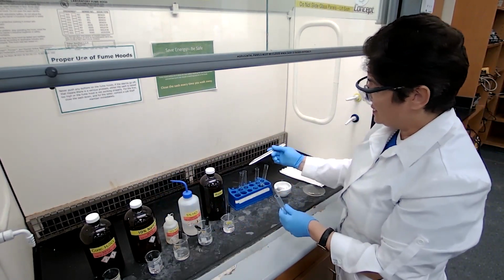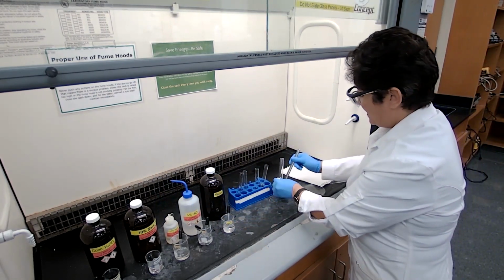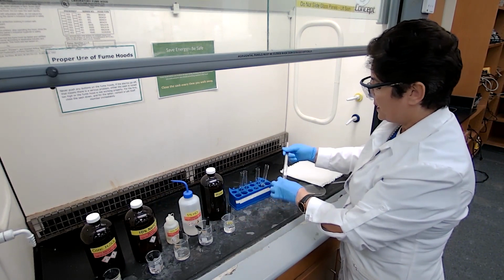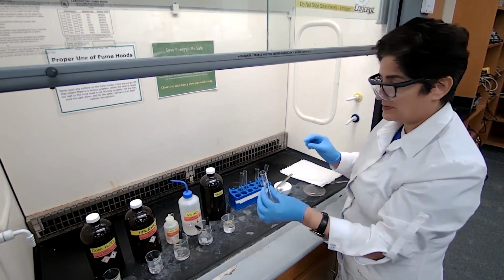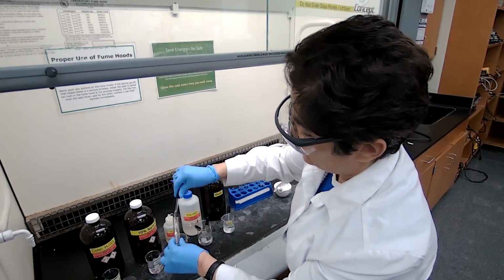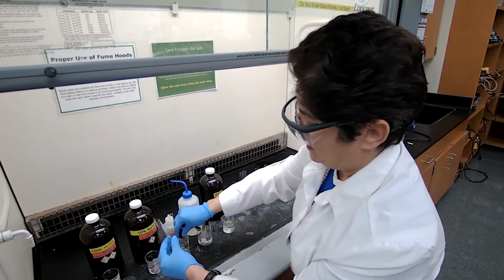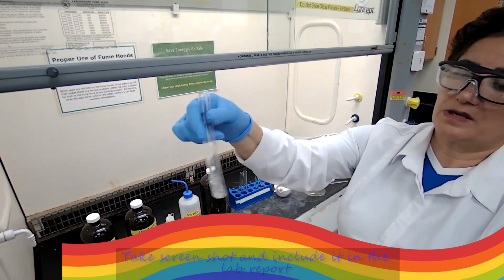I didn't add my samples to the test tube because I don't know where to stop. Maybe I have to do all of these. Maybe I can just, if it did dissolve in water, I didn't have to do the rest. So I'm adding the sample into the test tube, tip of a spatula again, 10% sodium hydroxide, 3 full droppers of the solvent, and mix it for 10 seconds and check the solubility.